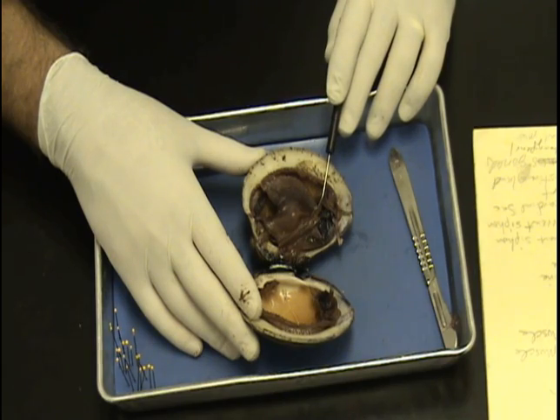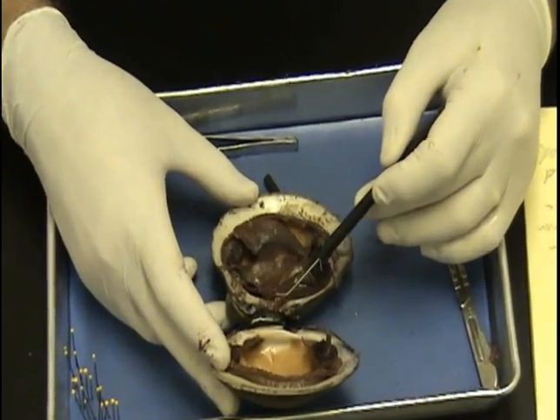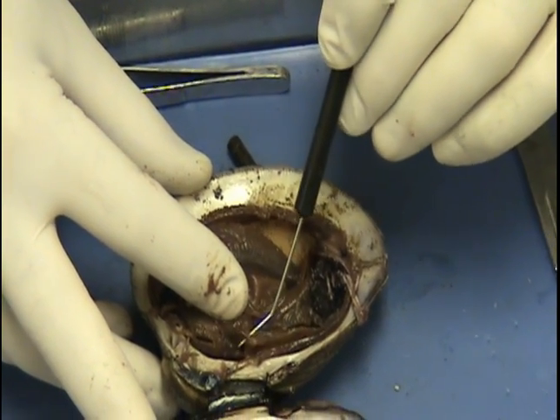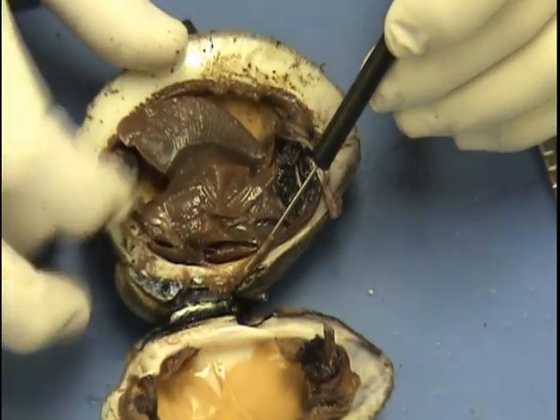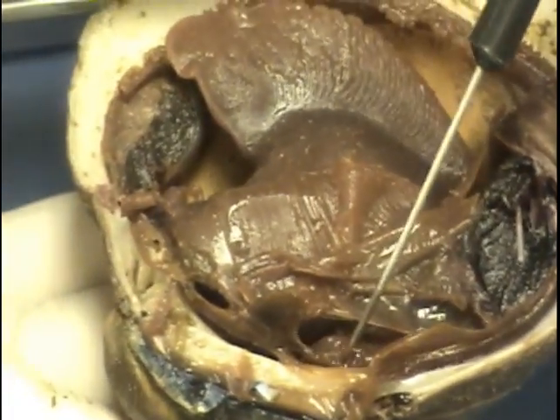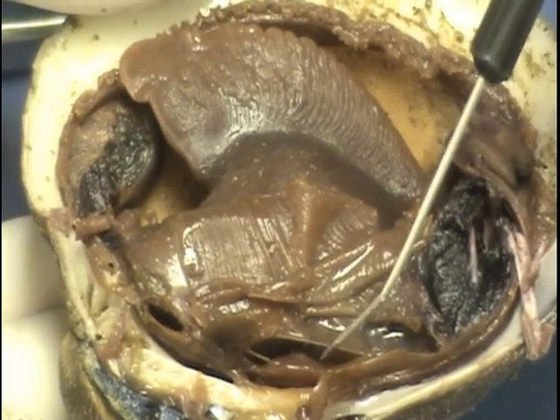Visceral mass — let's do the heart first: the heart and the pericardial sac. If we look just ventral from the umbo and move part of the gill out of the way, let's see if we can see the heart. Here's the pericardial sac right here — I'm kind of moving that out of the way so you can see. Here is the heart right there. I'm putting my probe right through one of the openings of the heart. So we've got the heart and the pericardial sac, which covers the heart.